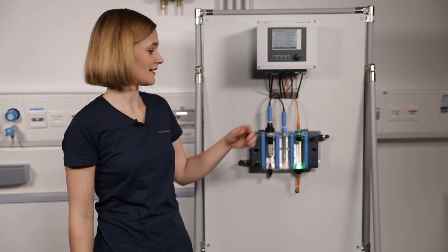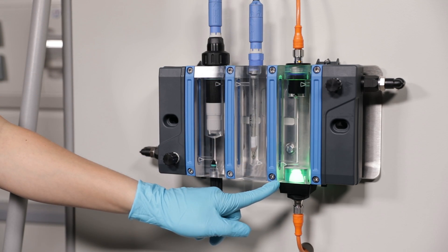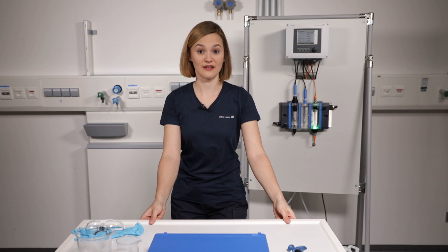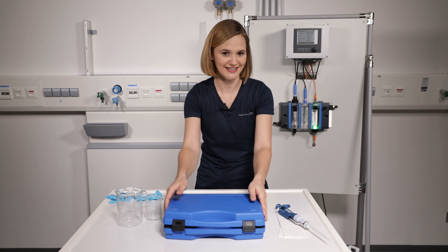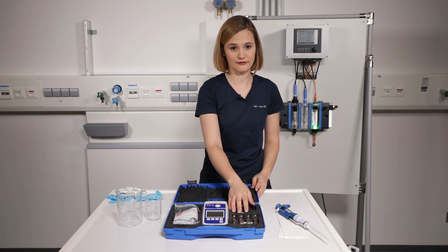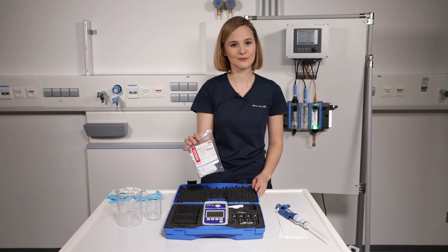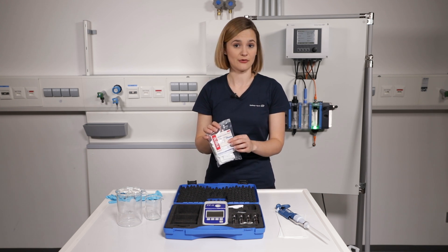The fulfillment of this precondition is indicated by the flow switch and the status indication light. For liquid analysis sensors like pH, calibration typically means measuring in a reference medium such as a buffer or standard solution. For disinfection sensors, this is different — the sensor remains in the process and the sample is taken out. This sample must be analyzed offline according to the DPD method, which is basically a colorimetric measurement done by a photometer. I recommend the PF3 photometer from Macherey-Nagel. The DPD reagent kit must match the correct measuring range, reagent type, and dosing — I personally recommend the powder pillows because they are very easy to handle.